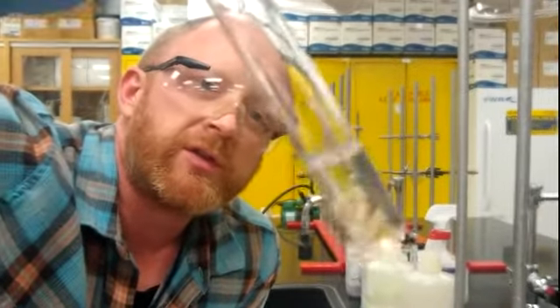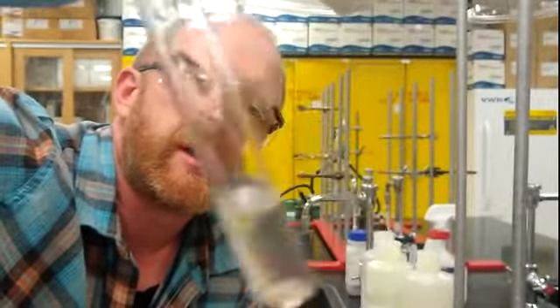And as you can see, we are not getting a soluble result on that. It's not even attempting to dissolve, so we will call that insoluble.